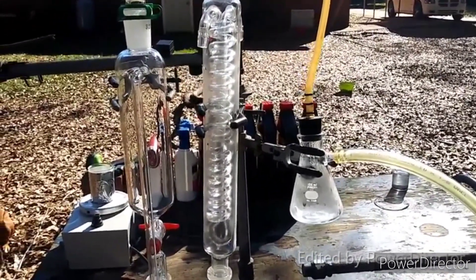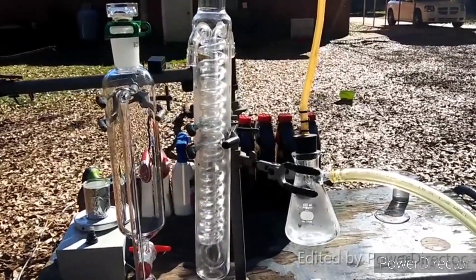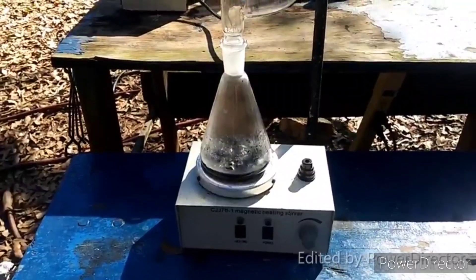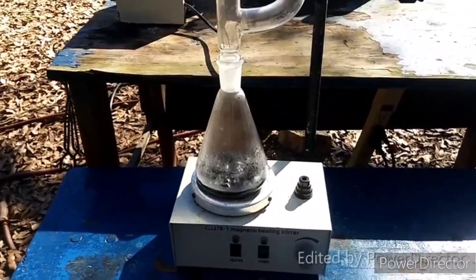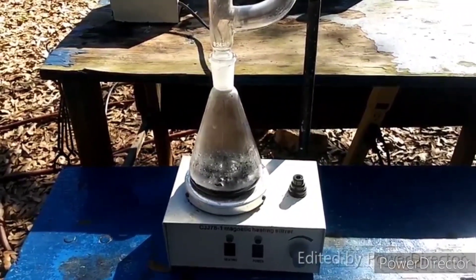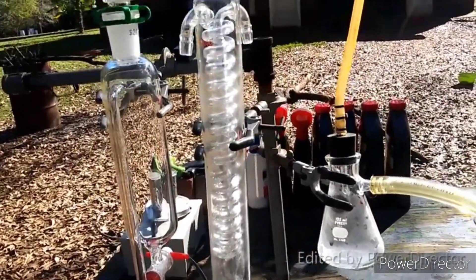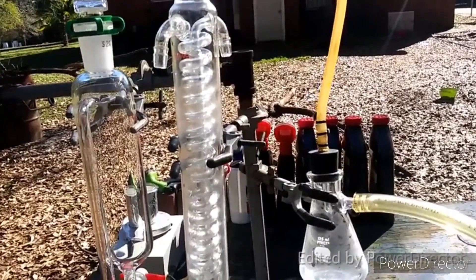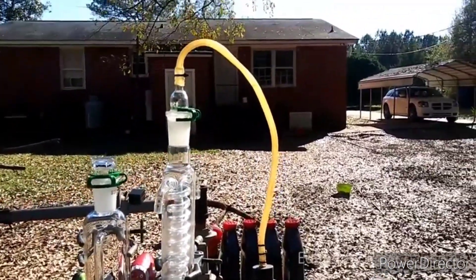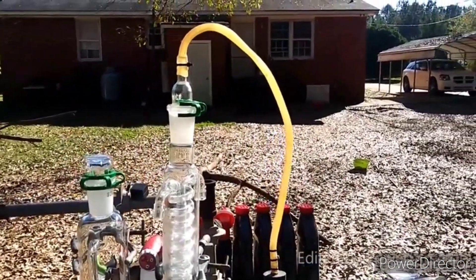The reason I'm having the gas go through that condenser is because I'm trying to eliminate all traces of elemental sulfur, which is usually produced when you produce hydrogen sulfide using ferrous sulfide. It has always been a royal pain in the ass. I'm really hoping that any elemental sulfur will be caught on the coil, which I can just wash with hot xylene afterwards to remove it. By the time the gas gets up here, it should just be hydrogen sulfide gas.